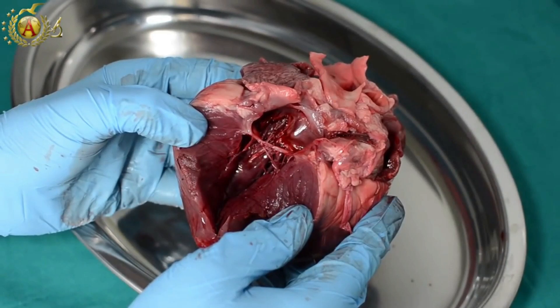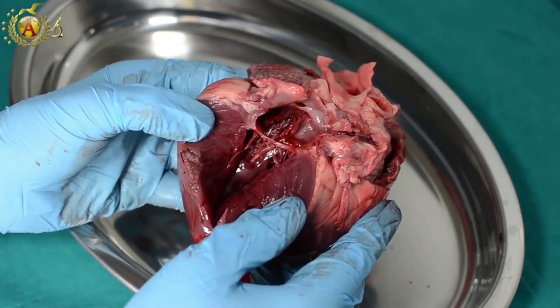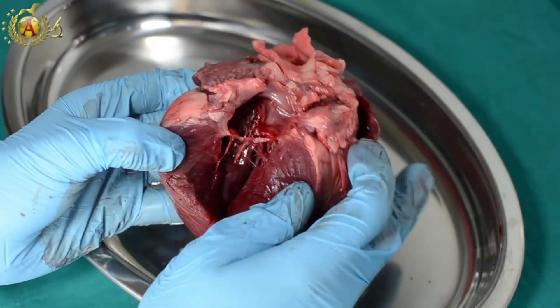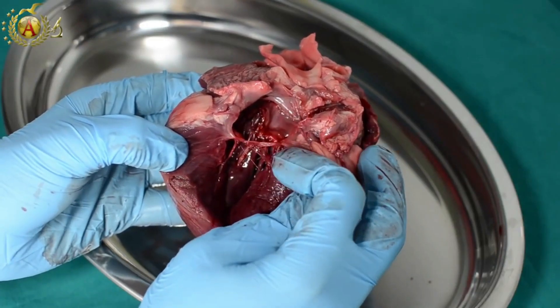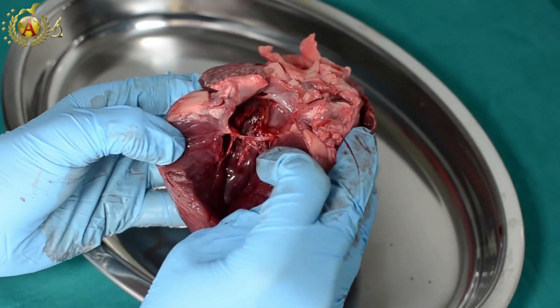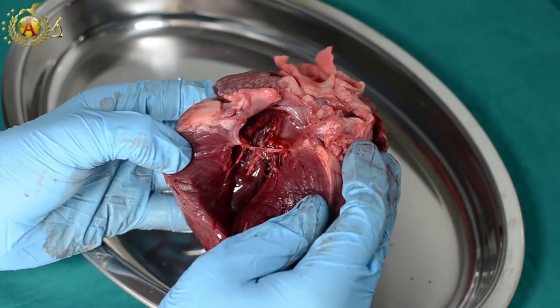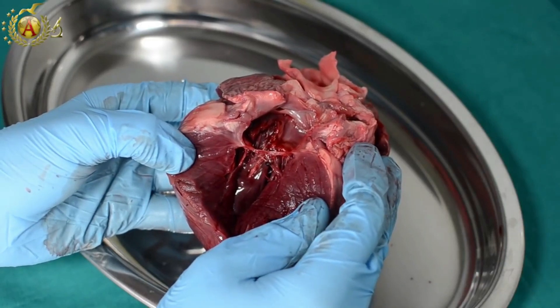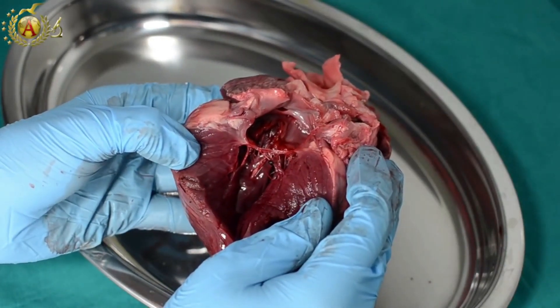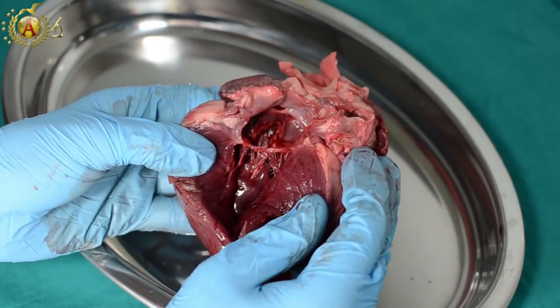We also opened a second plane to see the passage from the atrium to the ventricle. What we noticed is, first of all, the atrioventricular valve with its robust cusps. Then we have the chordae tendineae, here also very resistant. But the most interesting thing is the thickness of the wall, which is almost seven times thicker than the right ventricle's. Furthermore, even observing the receptive portion, we can note how it is less wrinkled than the right ventricle.